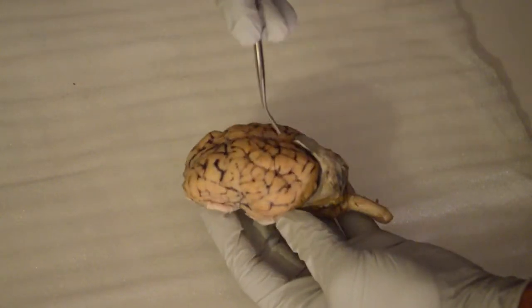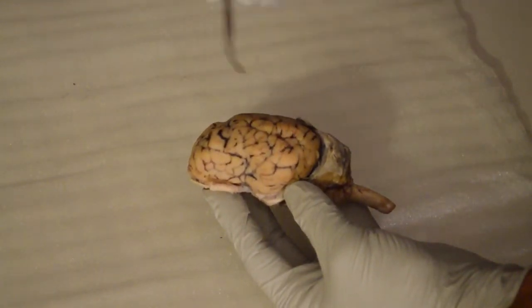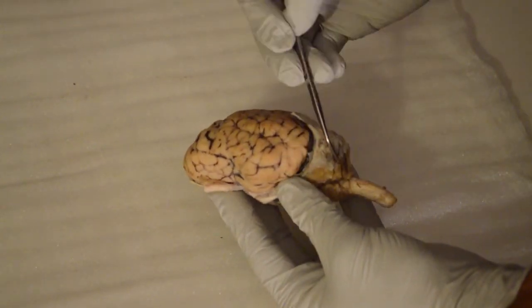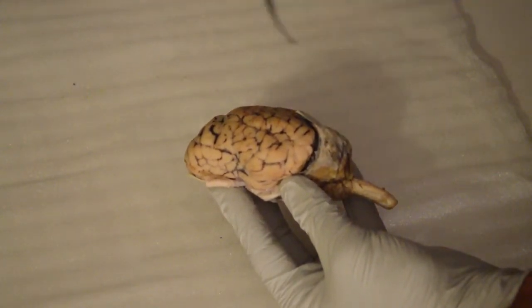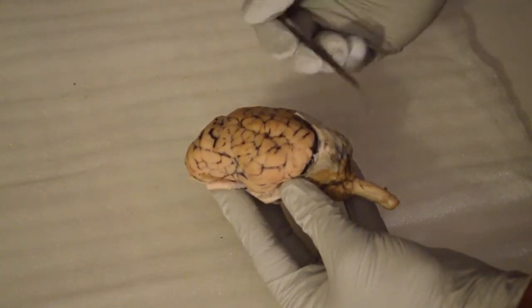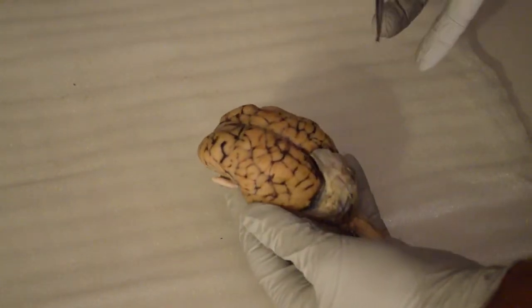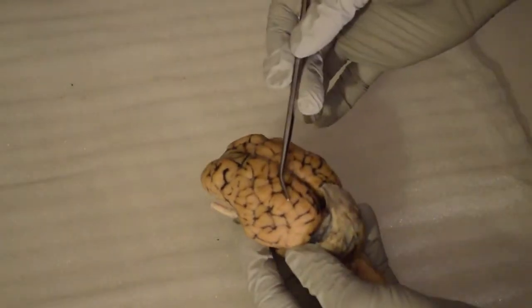Next, we'll move into the temporal region. The temporal region is involved with the auditory system and is responsible for hearing. Next is the occipital region of the brain. The occipital region involves the visual cortex, or the visual processing system. That's back there. Moving on to demonstrate the gyrus and the sulcus.